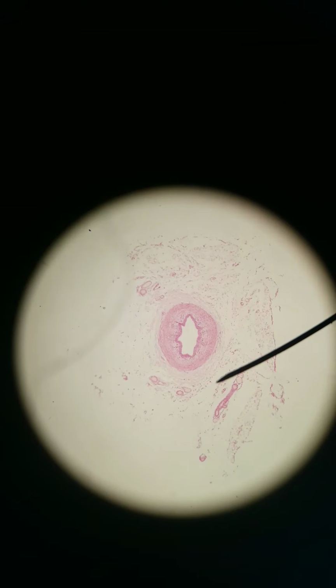Hey y'all, we are taking a look at more of the urinary system. We're looking at the urinary tract. In another video we looked at the kidney, nice long video there. The kidney was mostly epithelium because you have nephrons and you've got simple squamous, simple cuboidal, simple columnar.